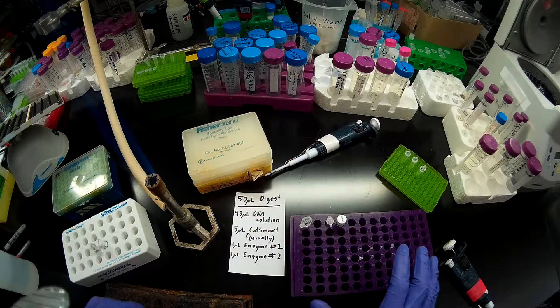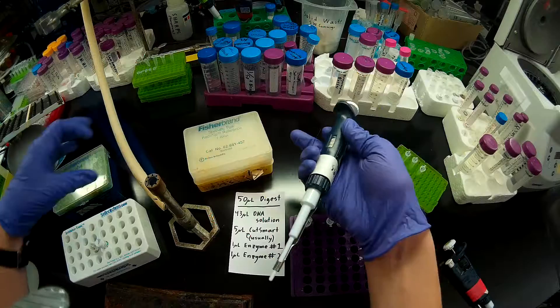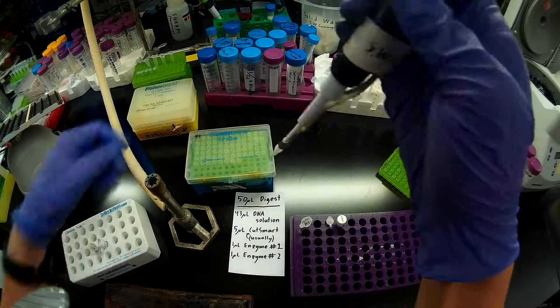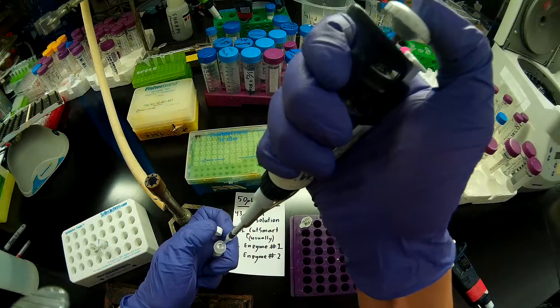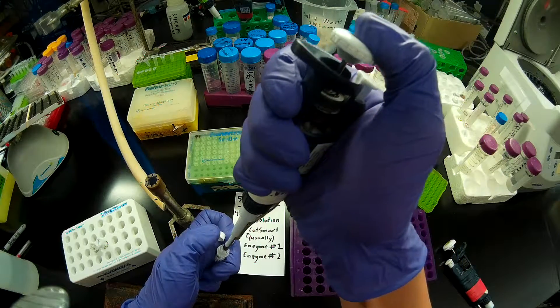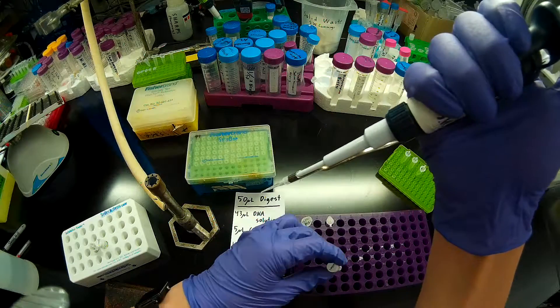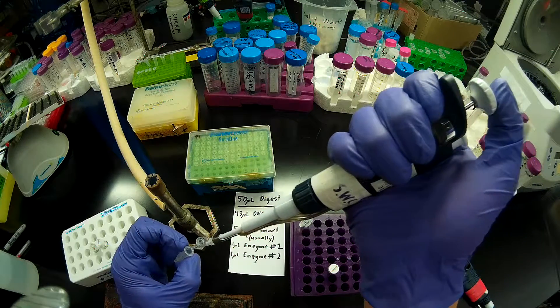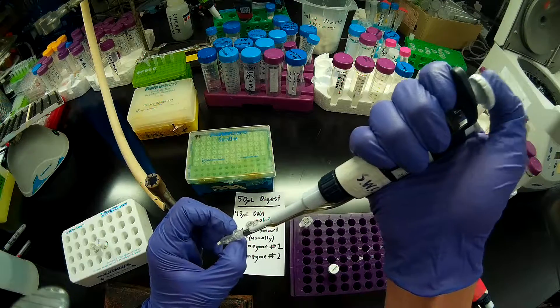To this 50 microliter digest, I'm going to add 5 microliters of CutSmart — already set to 5 microliters. You'll note that I'm working under a flame here to prevent dust or anything from settling into my samples and my buffers. Mix that well by pipetting.